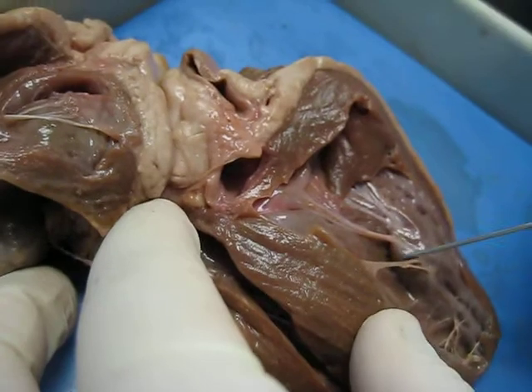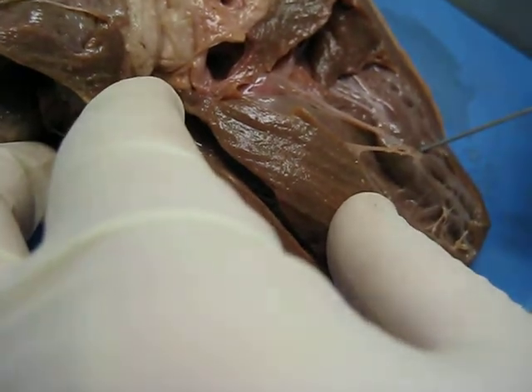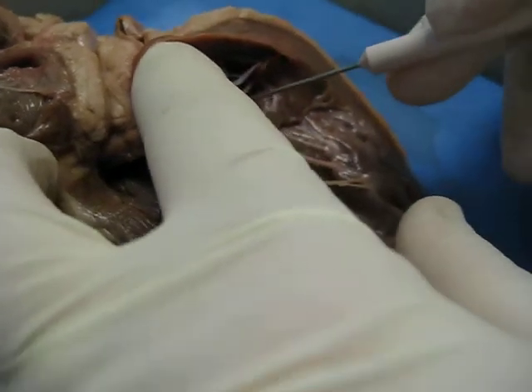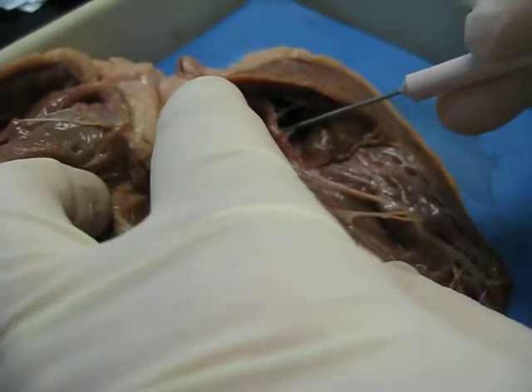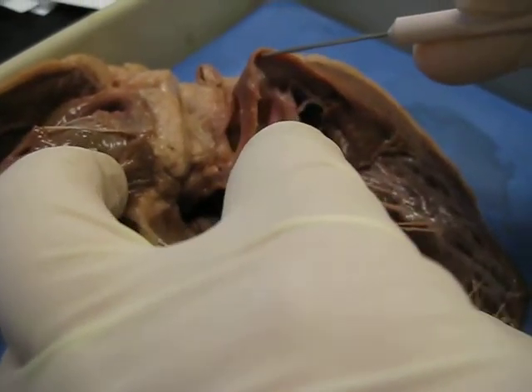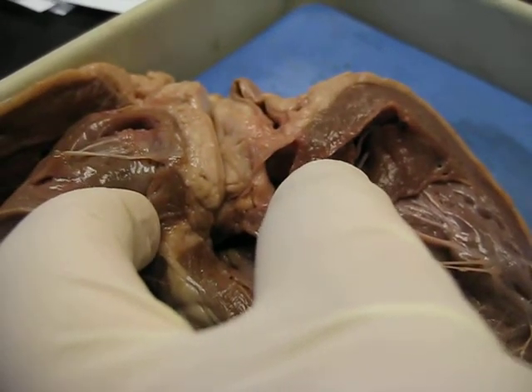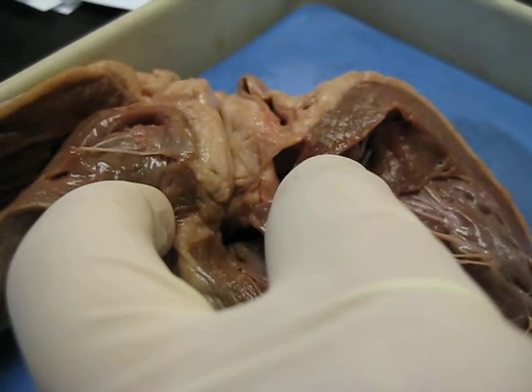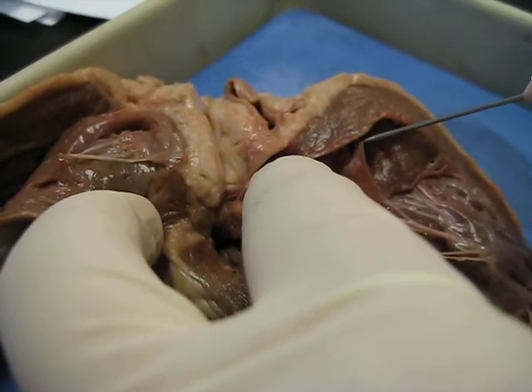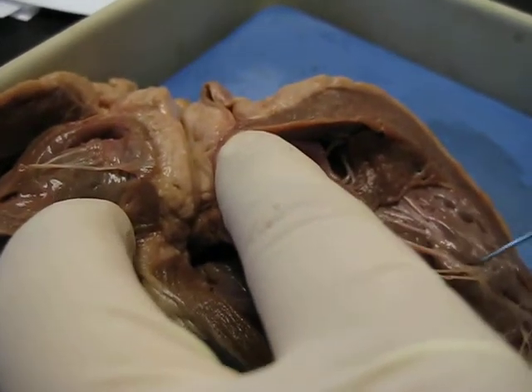Okay. Now in here we have the big fat section here, the papillary muscle, connected to the chordae tendineae, which go up against the flap or cusp. Now this one, since I'm on this side, how many cusps am I going to be looking at? Bicuspid. Remember, you try before you buy. If you follow the flow of blood through the heart, you go through the tricuspid before you go through the bicuspid. Try before you buy. Okay, so this is going to be the bicuspid, left atrioventricular or mitral valve. Has 3 names.